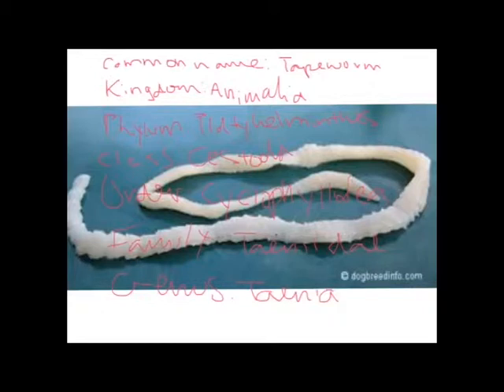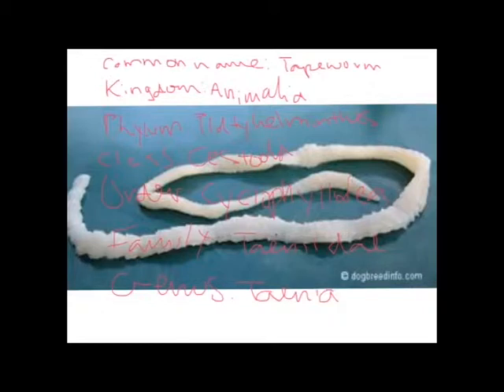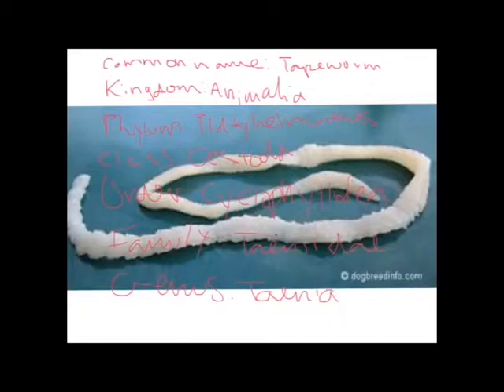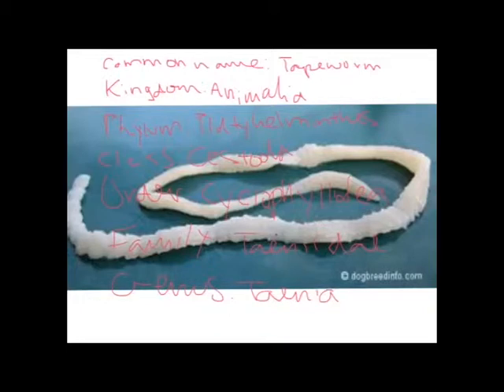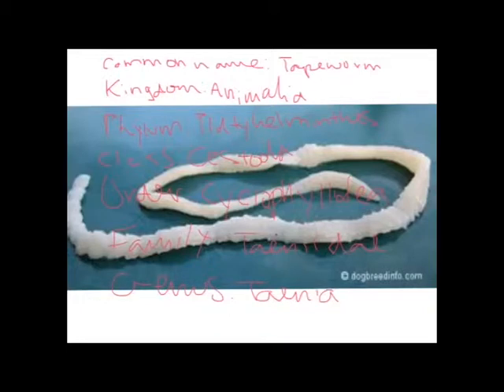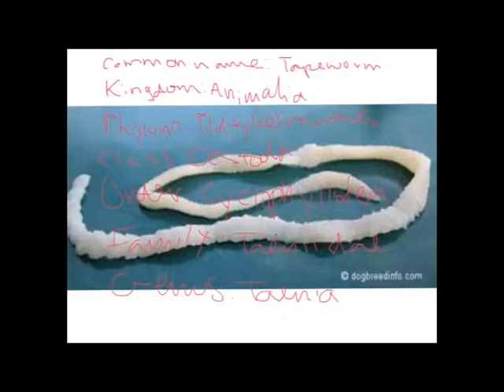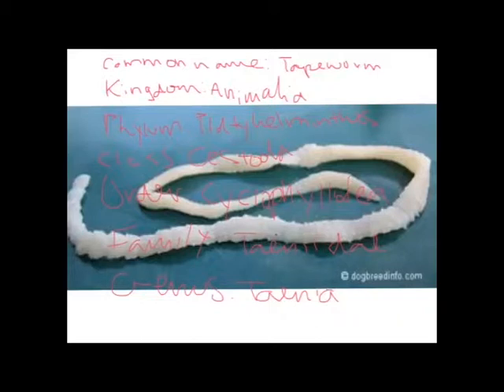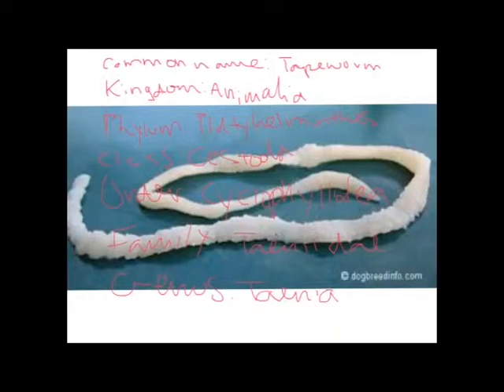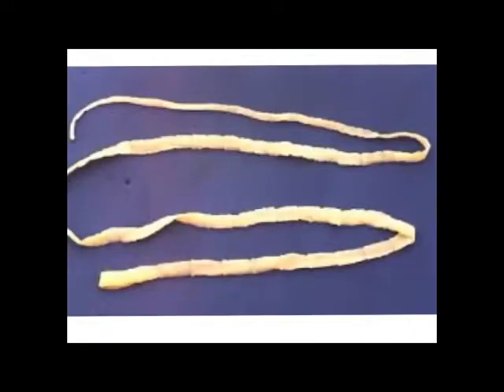The common name is the tapeworm. The kingdom is Animalia, the phylum is Platyhelminthes, the class is Cestoda, the order is Cyclophyllidea, and the family is Taeniidae, and the genus is Taenia.